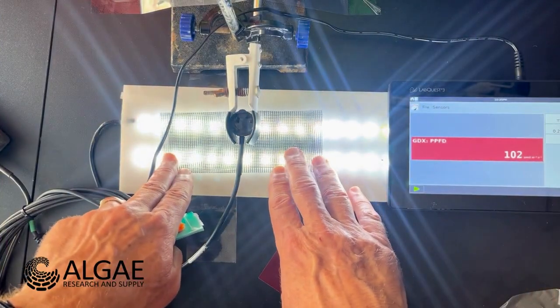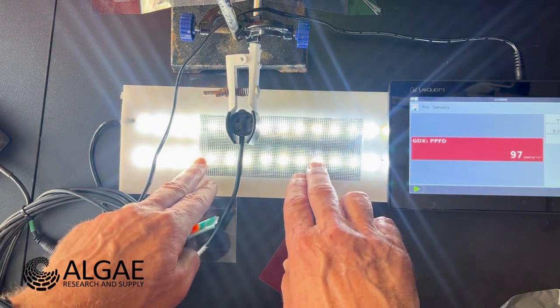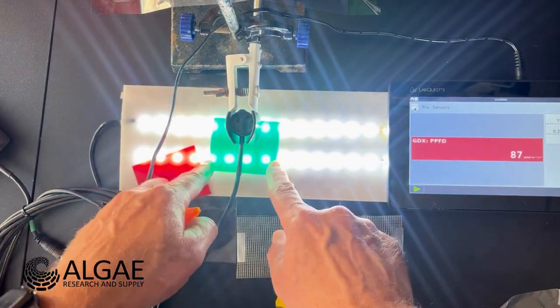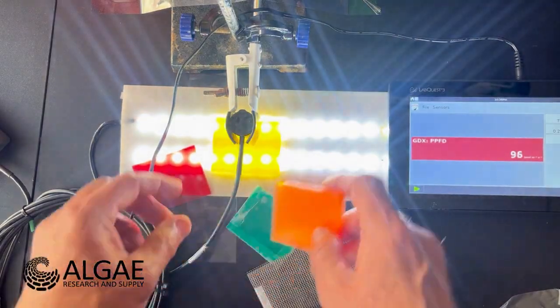All right, so now we've made different layers of those light filters, and here's the screen now because that's our neutral density filter. We've got one layer of the red and then several layers of all of the other colors here so that we can match the total flux of photons for each color.